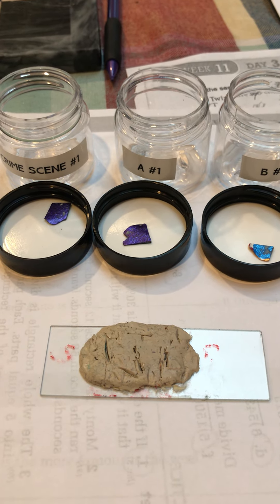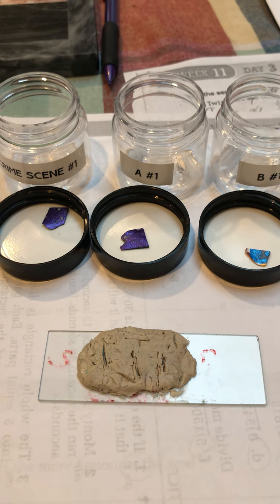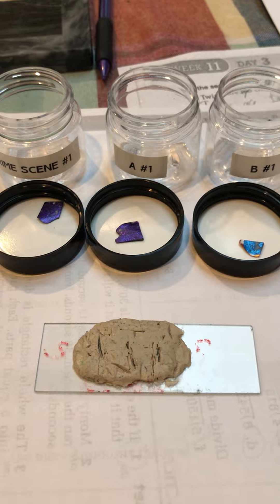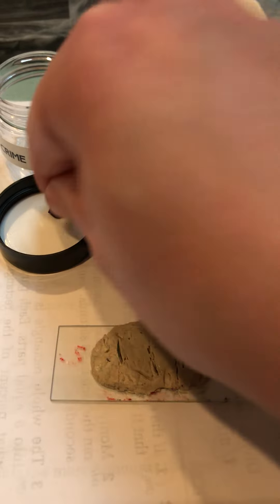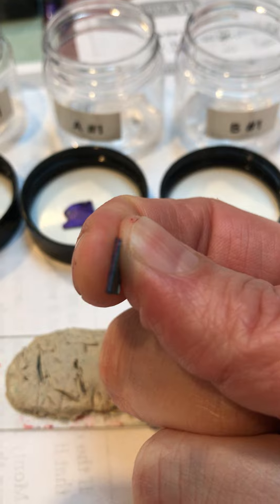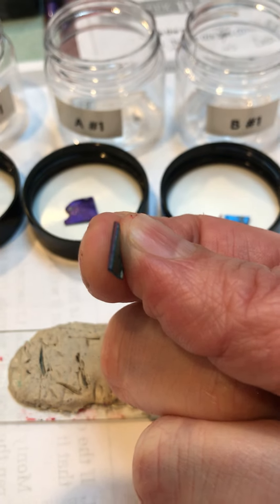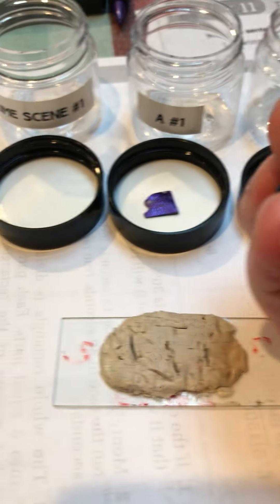We're going to remove our paint chips from the vials, which we've already done, and then pick them up and look at which edge of the paint chip shows the most layers.